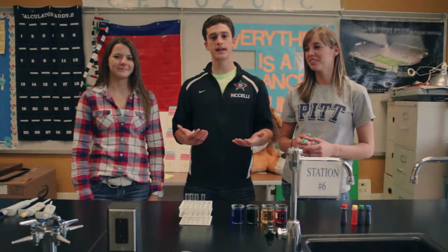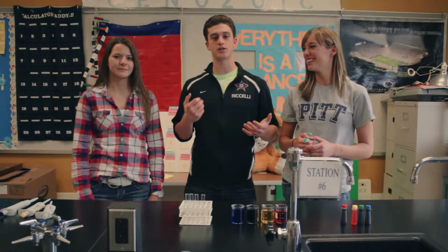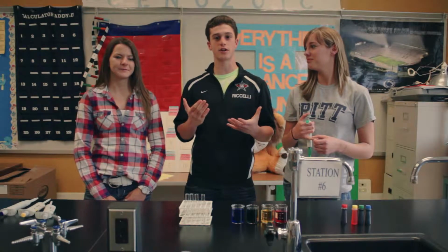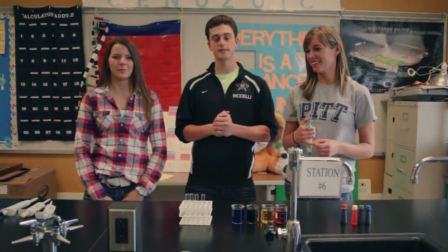Hi, we're Lab Group 3, and for our final video, we're going to show you how to use a micropipetter. I'm Maggie, and I'm going to show you a demonstration. I'm Vince, and I'm going to show you the parts of a micropipetter. I'm Carrie, and I'm going to show you what not to do with a micropipette.